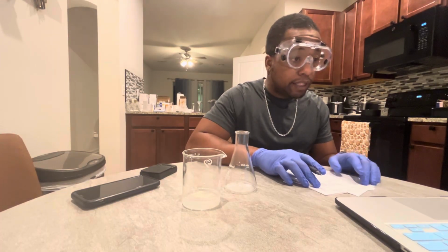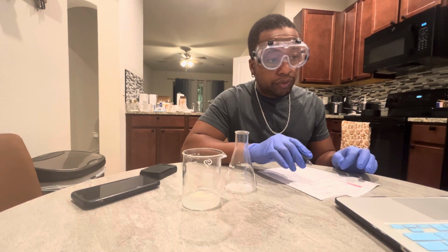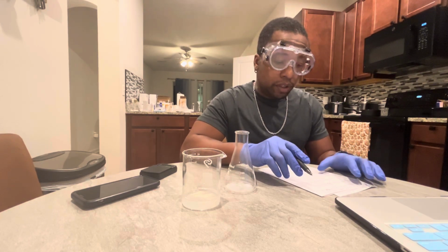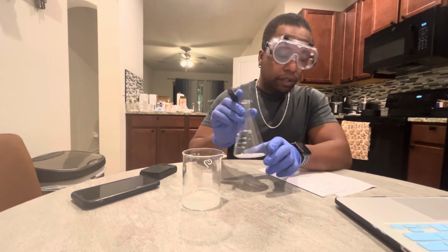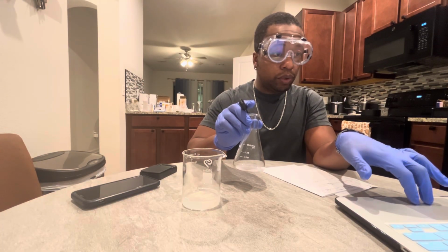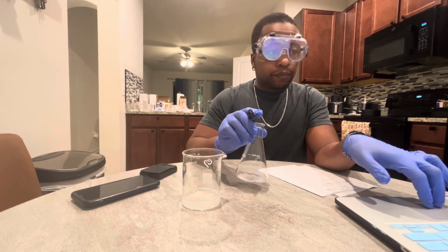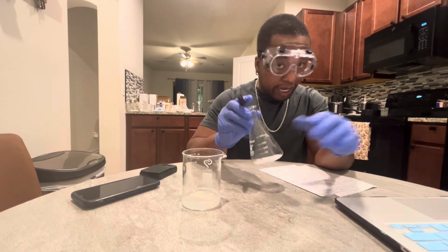Step 11: determine the mass percent of salt dissolved in the saturated salt solution. In order for me to determine the mass percent of the salt dissolved, I need to find the mass of the salt by itself. Because the mass percent of the salt is the mass of the solute divided by the mass of the solution times 100. I don't have the mass of the solute yet, which is what I'm going to calculate first.